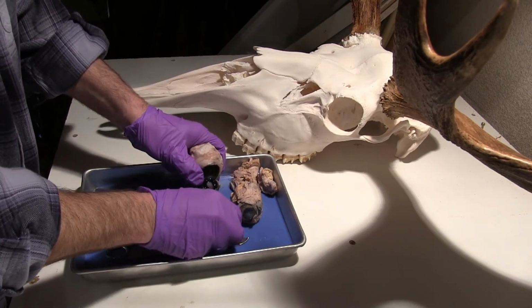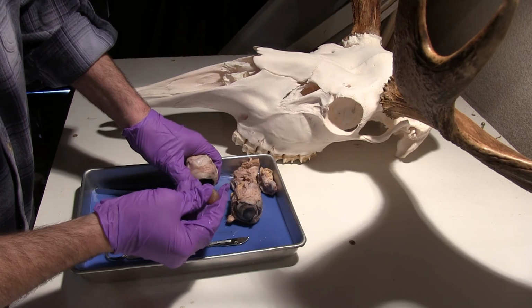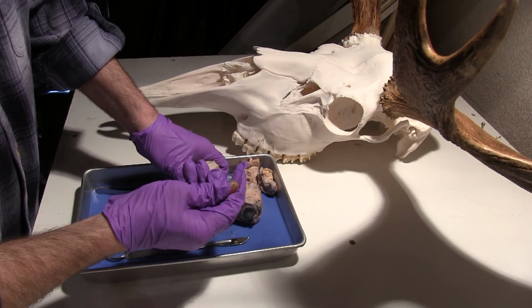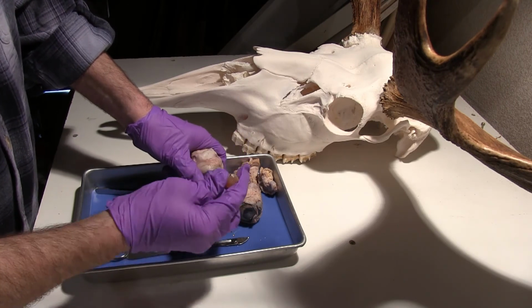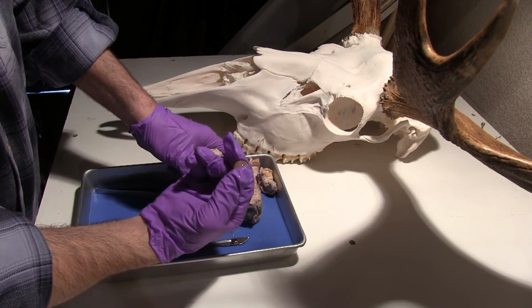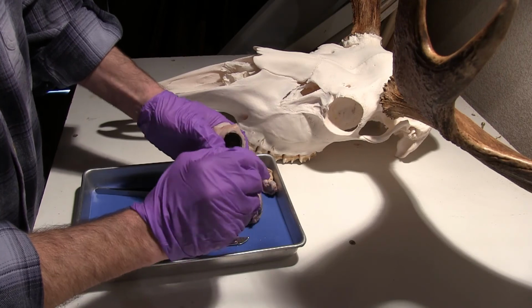And then it's always interesting to feel what the lens feels like. It's a whole lot harder than you'd imagine. And in this preserved specimen, it's even harder than it would be if this was a fresh eyeball. Now this, of course, can change in shape as we get older. This becomes stiffer and not able to move as much, so that hurts how well our vision works as we get older.